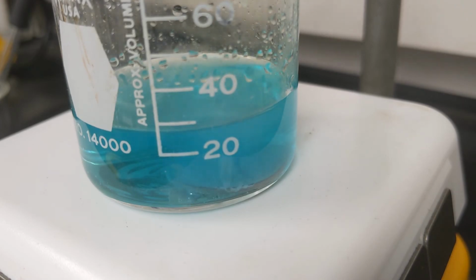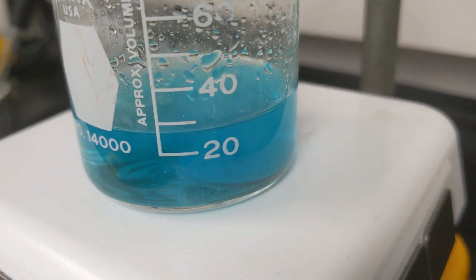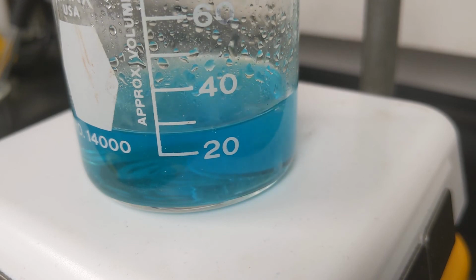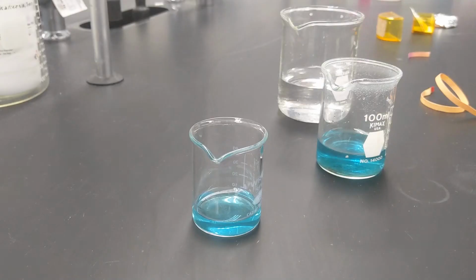Instead, I'm going to show you what I did to get the powder and maybe what you shouldn't do, ways to make this a little bit easier on yourself. In this first reaction, we have nitric acid dissolving the silver and other metals, mainly copper, found in the coin. The idea being that once it's in this liquid state, I can separate the copper from the silver and create a silver powder more easily than if I had just tried to grind the original coin down. As we'll see, the process did not go so smoothly.